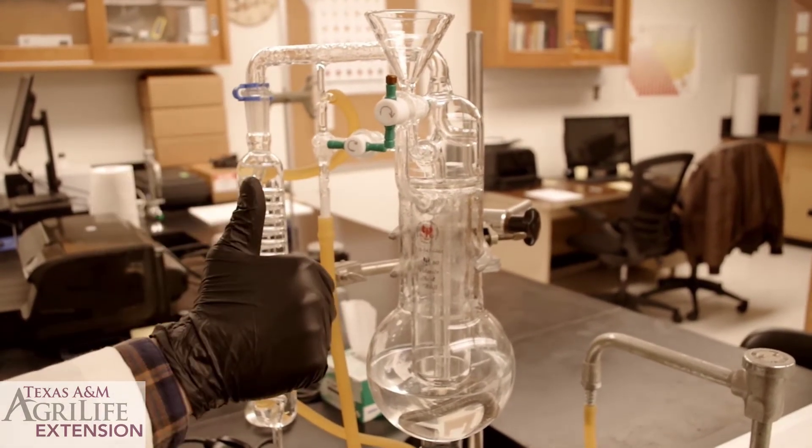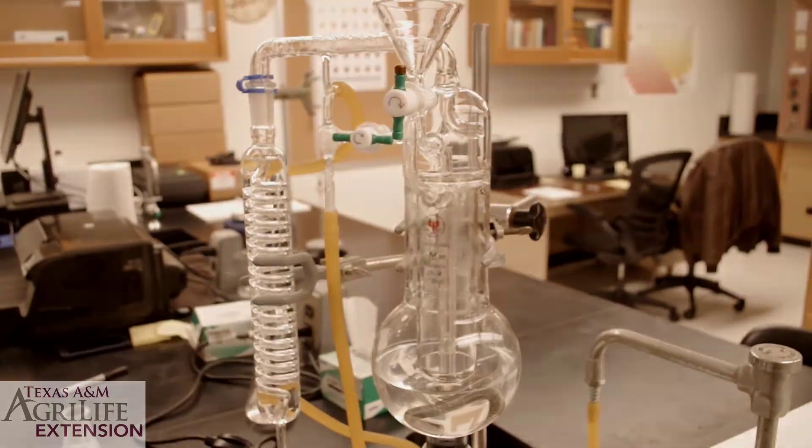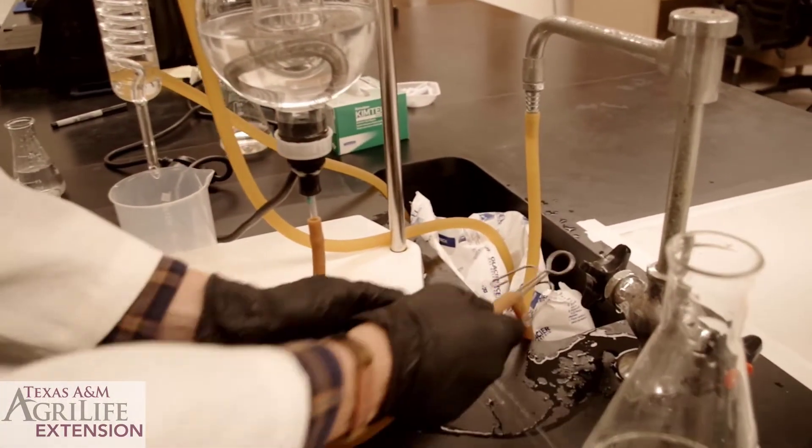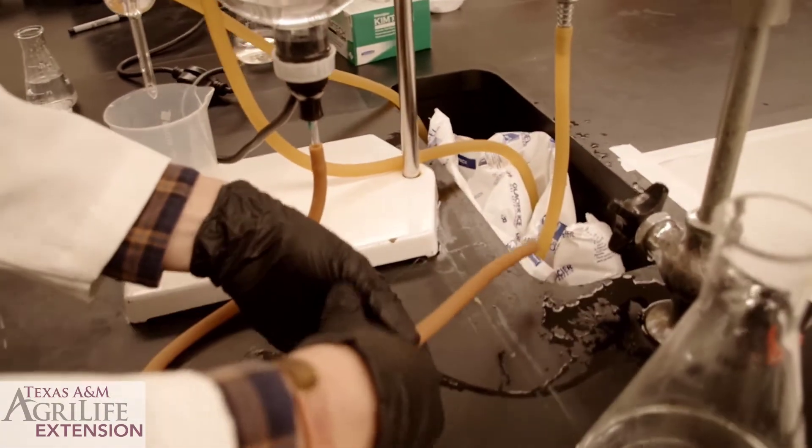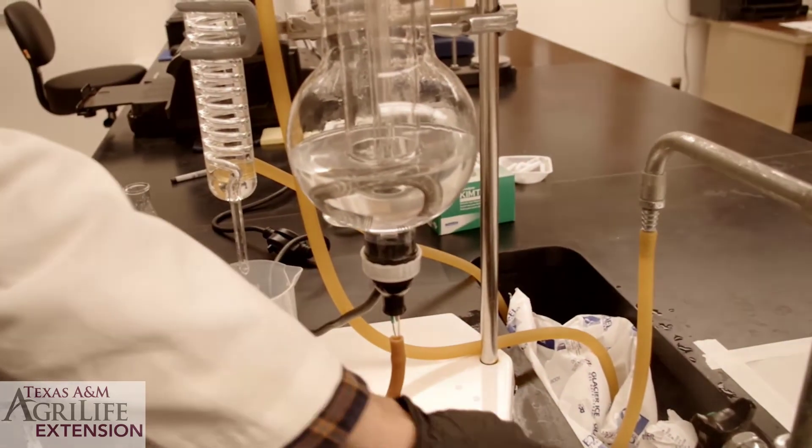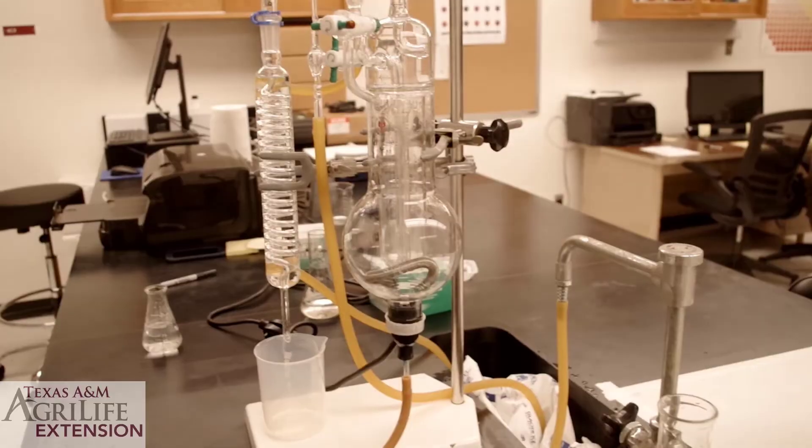Your machine is now clean and ready for your next sample. If you don't want to run any more samples, drain the water from the boiling chamber into the sink by unclamping the draining hose. Be careful, the water is hot.